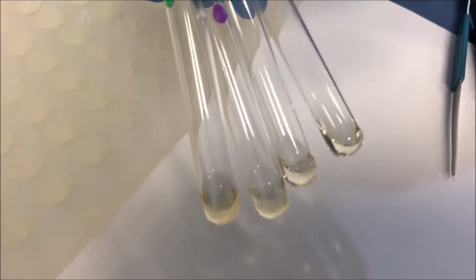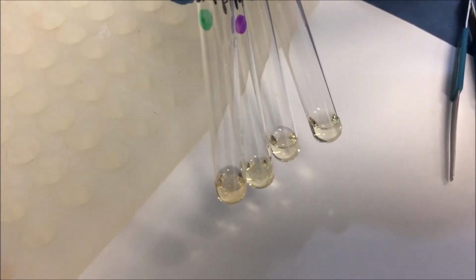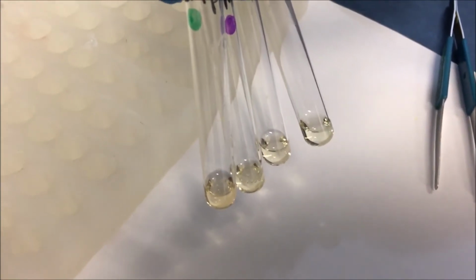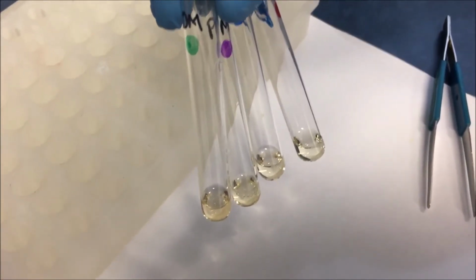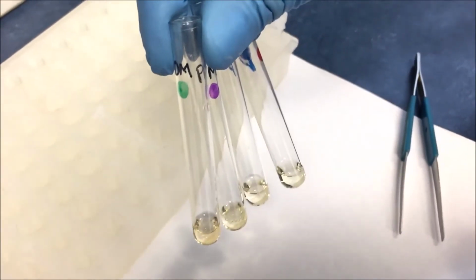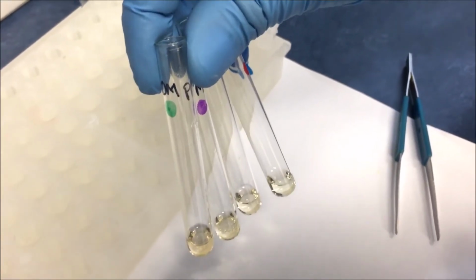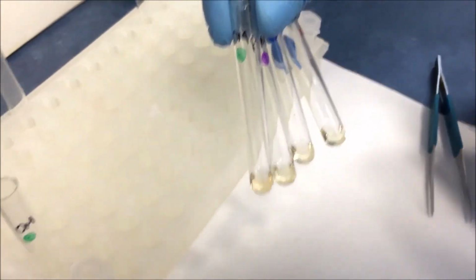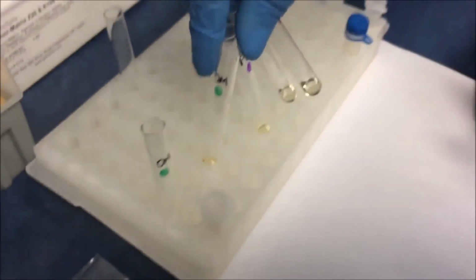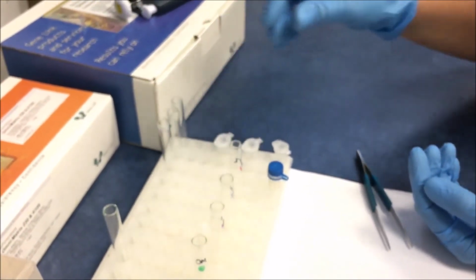So whatever the sample was, 100% of the sample is dissolved in the lysis buffer, and then it can follow through the procedures of automated extraction or manual extraction. The DNA collected is far superior, and in almost 100% yield, from the Omni-Matrix as compared with the swab. Thank you so much.